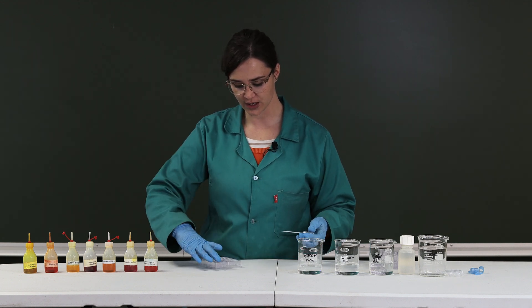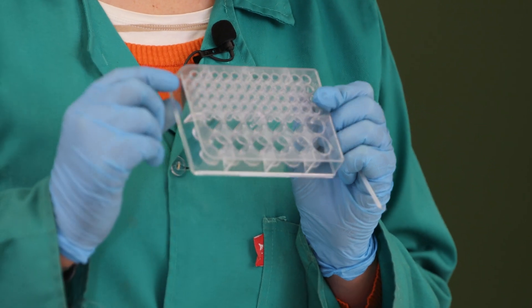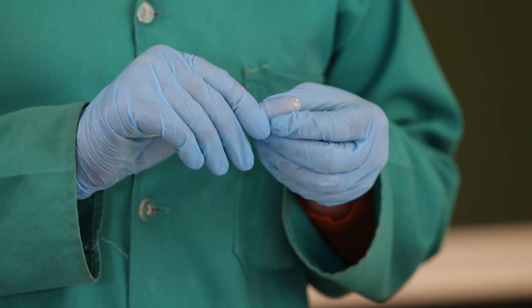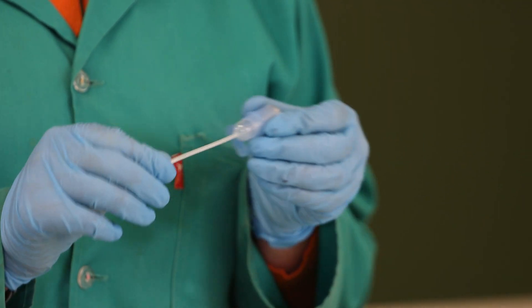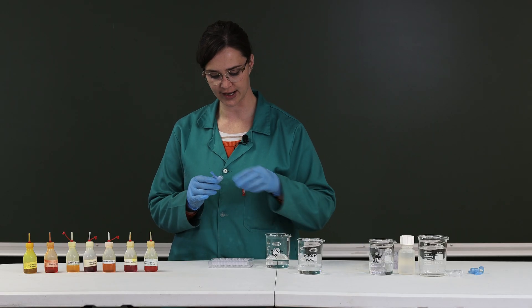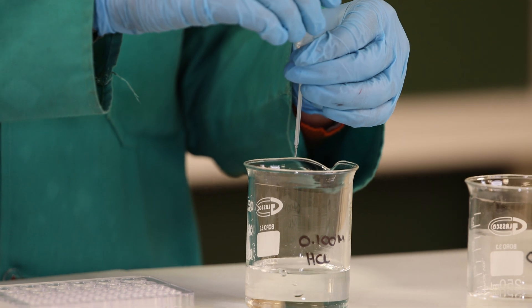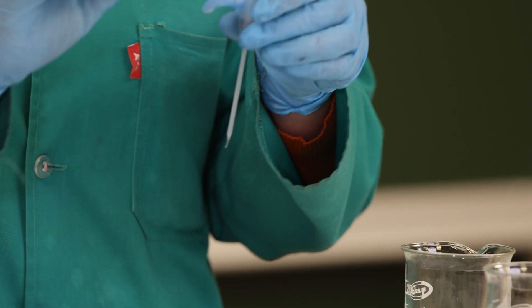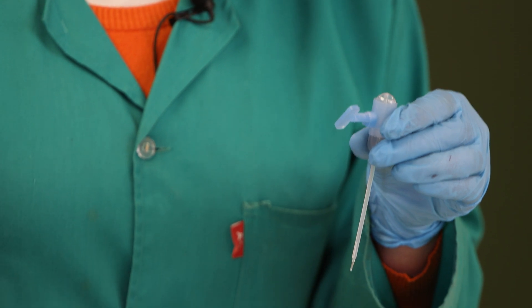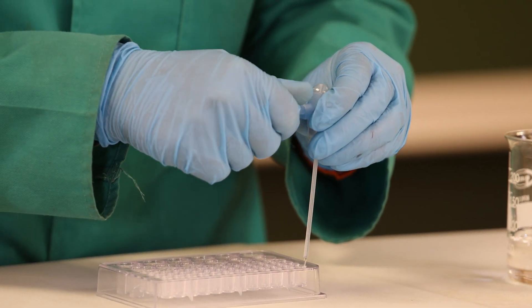For the first part of the experiment we are going to use wells A1 to A7. You can see the combo plate is labeled A down to F on the side. We add 10 drops of hydrochloric acid to each well. To ensure we add dropwise we use the drop controller — suck the HCl into the propette, fit the drop controller, and as you tighten it a slight force lets you measure one drop at a time.